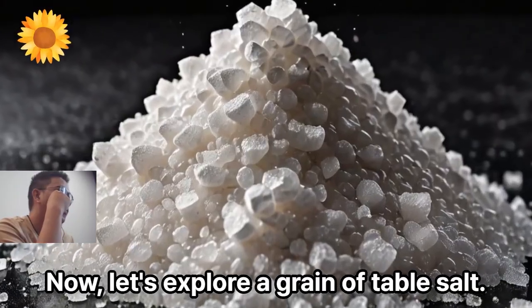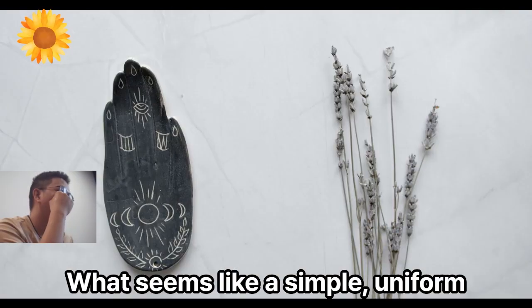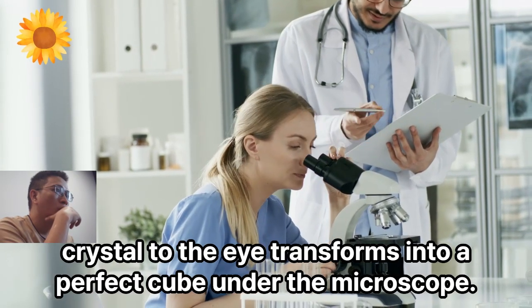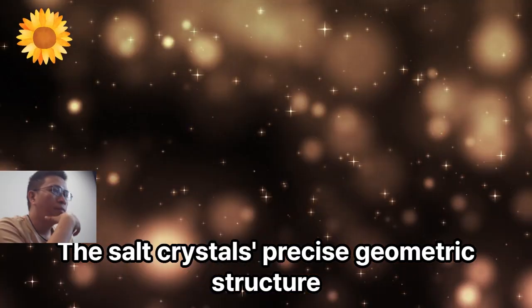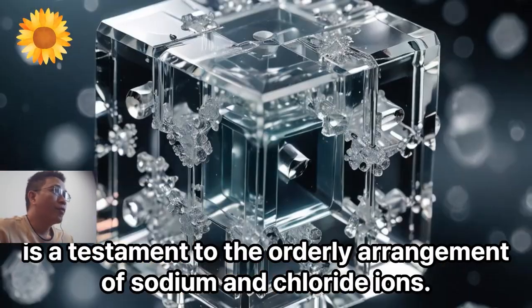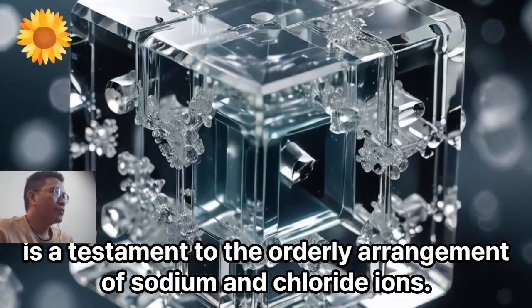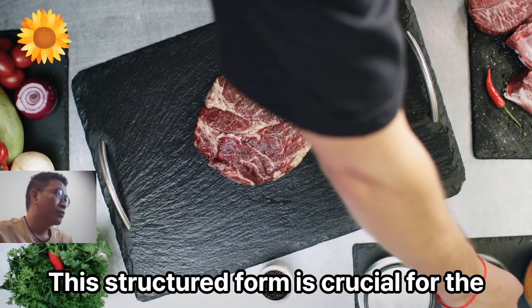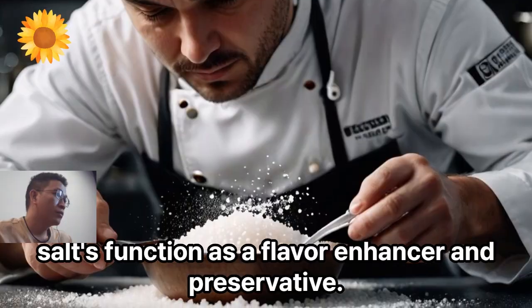Now let's explore a grain of table salt. What seems like a simple uniform crystal to the eye transforms into a perfect cube under the microscope. The salt crystal's precise geometric structure is a testament to the orderly arrangement of sodium and chloride ions. This structured form is crucial for the salt's function as a flavor enhancer and preservative.